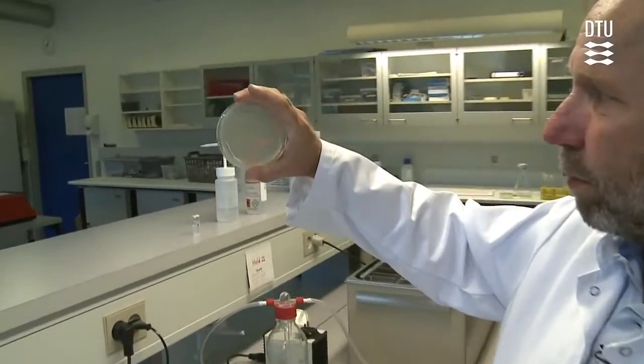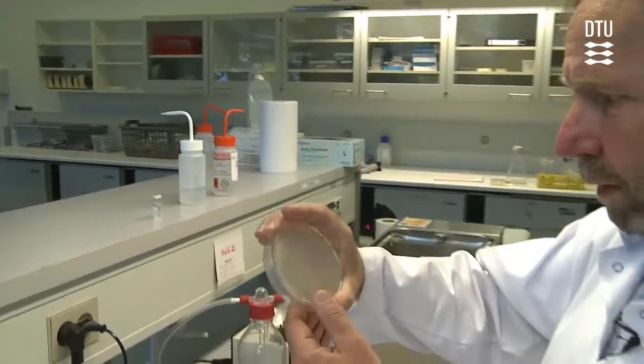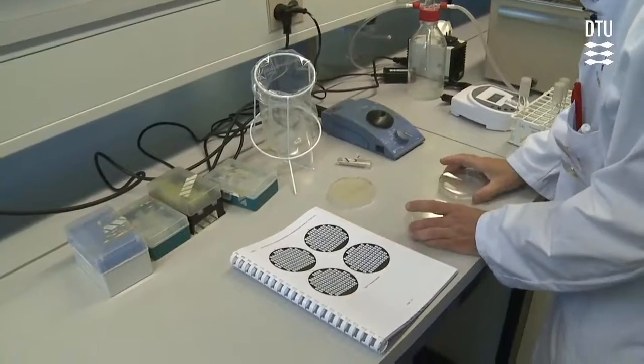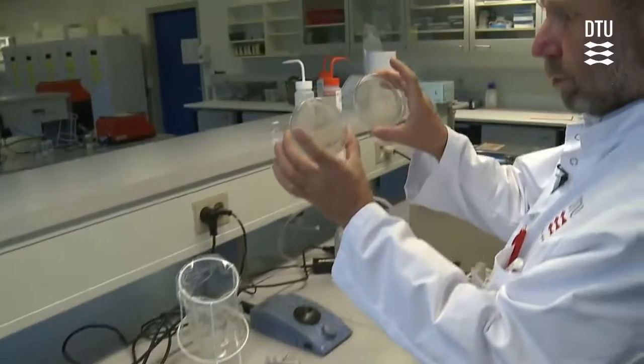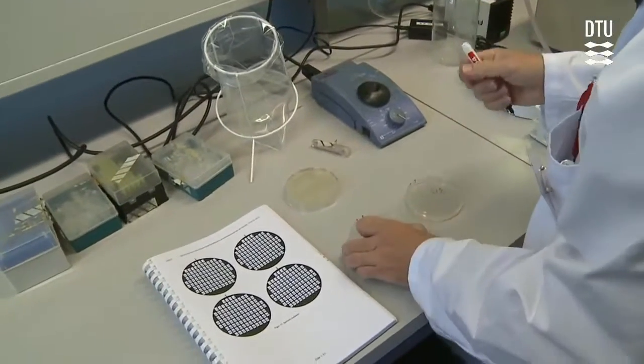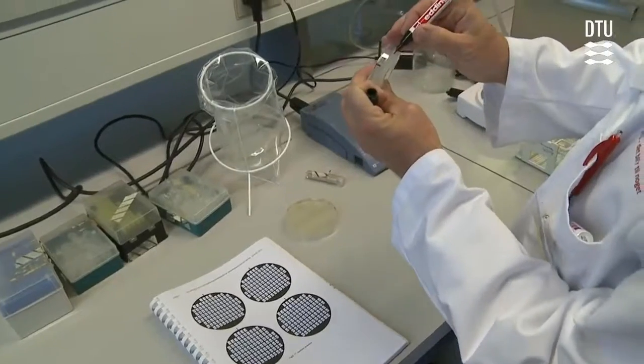Next day, hopefully you will see a lot of colonies. In this case, it is pretty successful. There are lots of colonies to test. What we are going to do is screen the bacteria, the colonies, for an arginine requirement. We have a plate with arginine and a plate without.